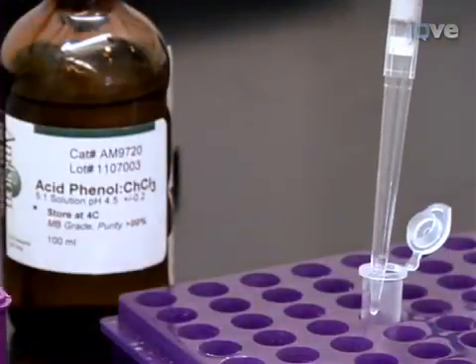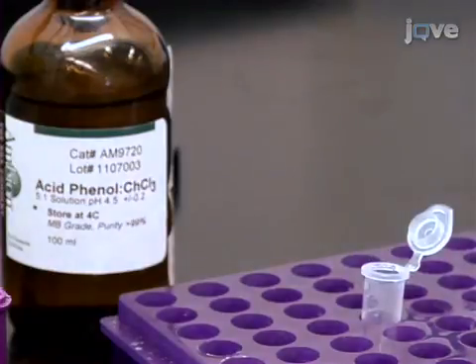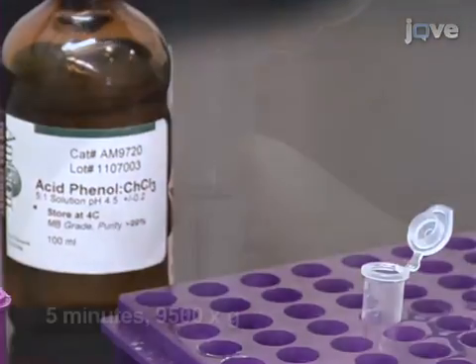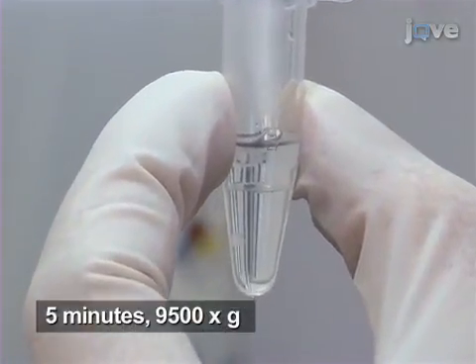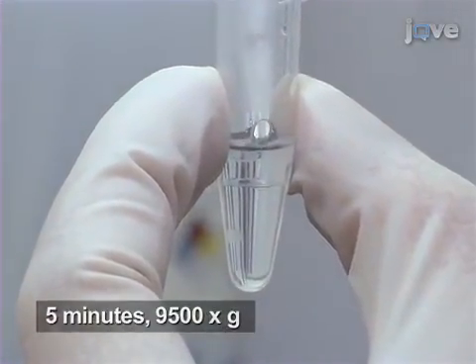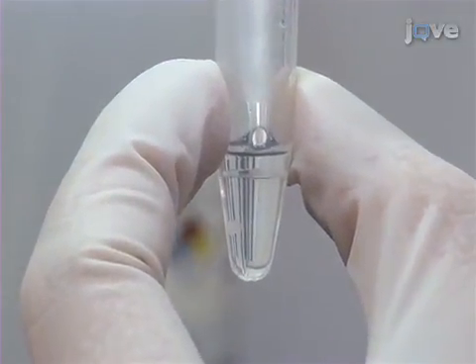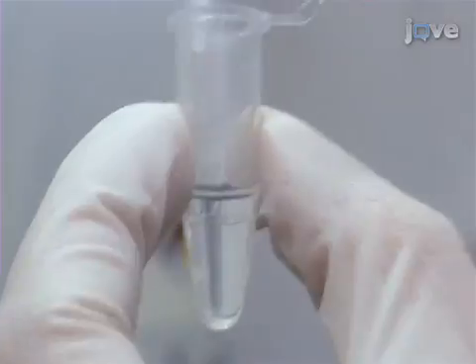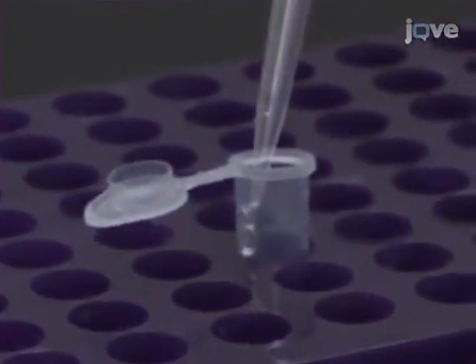Now add 300 microliters of the acid phenol chloroform and vortex the tube for 30 more seconds. Then, after spinning down the cells for 5 minutes at 9500 times G, carefully transfer the upper 300 microliters of the supernatant containing the aqueous phase to a new 1.7 milliliter Eppendorf tube.